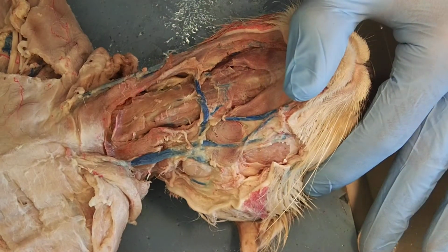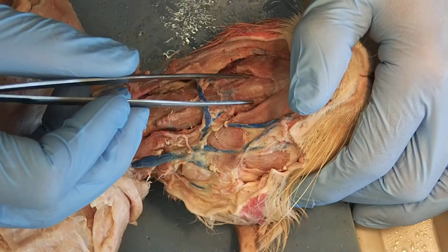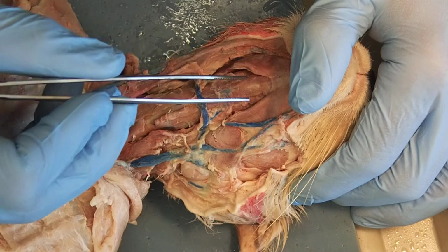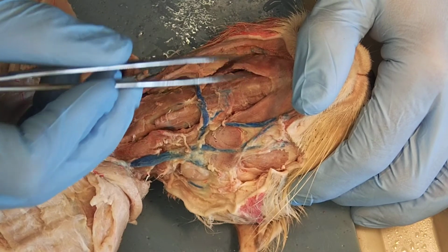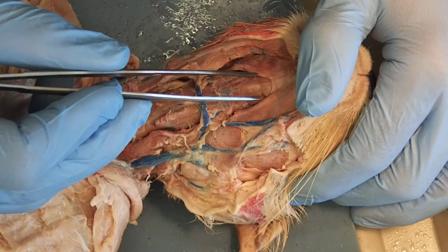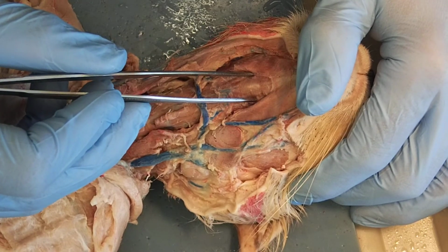I'm going to tell you a little bit about some root words in just a little bit. But I'm not sure about mylo. I have to look that one up. Mylohyoid. Sits deep to my digastric. Here's my digastric on both sides. And my mylohyoid basically covers the superficial part of the chin.